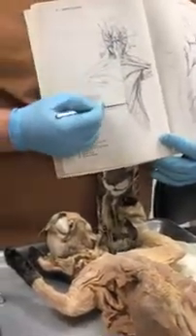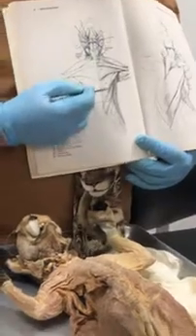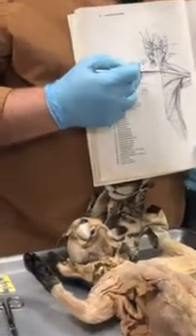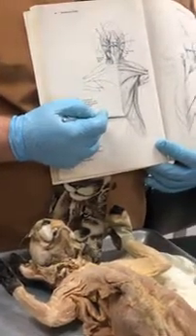And then we have another one over here, and that's also unique to the cat. That connects the xiphoid process to the humerus. What do you think that muscle's called? Xiphohumeralis, right? It makes sense. So again, pectoantebrachialis, pectoralis major, pectoralis minor, xiphohumeralis. Let's see what it looks like on the cat.